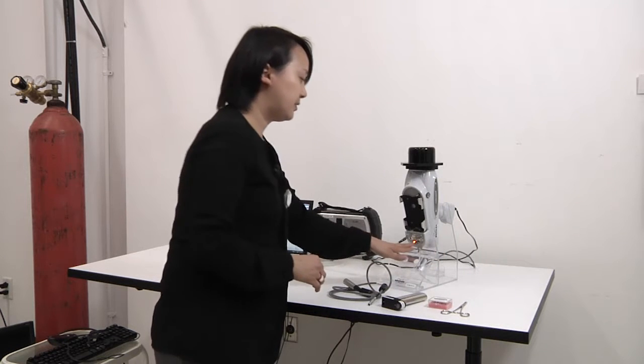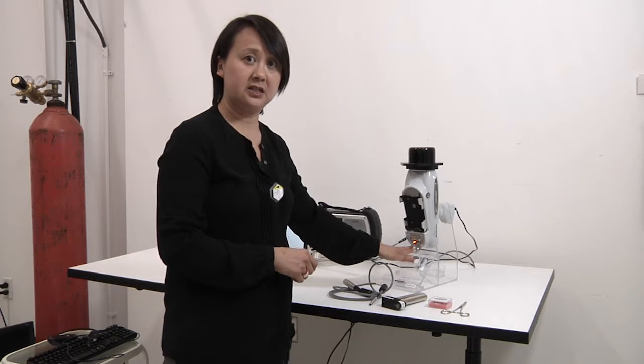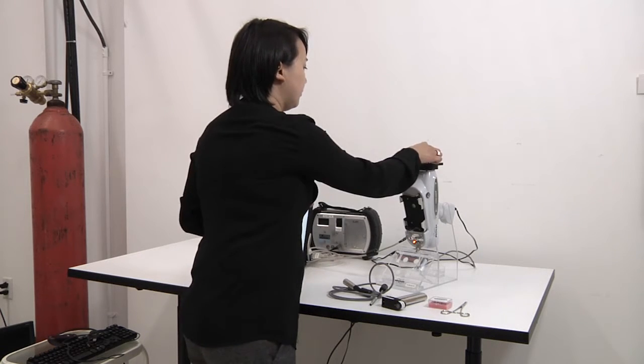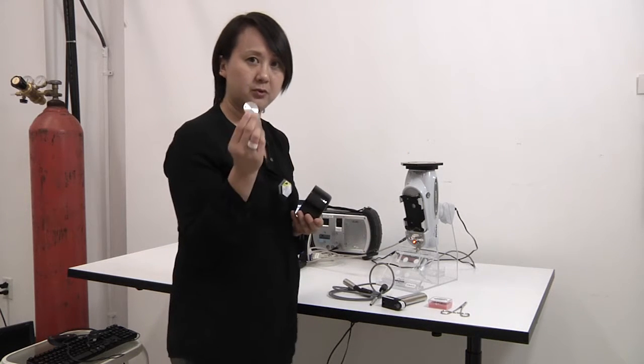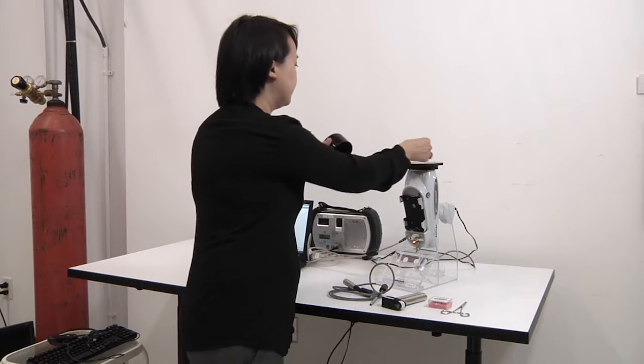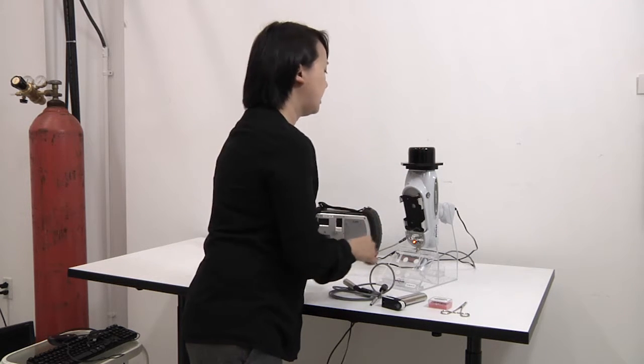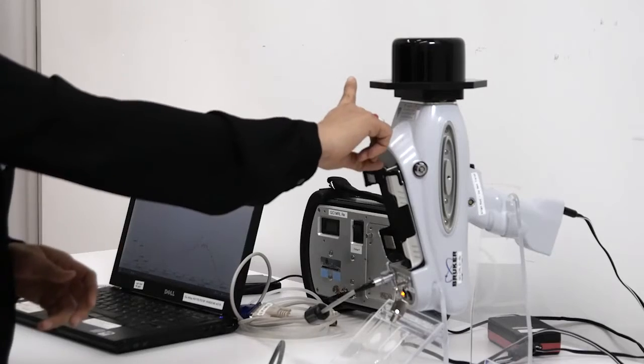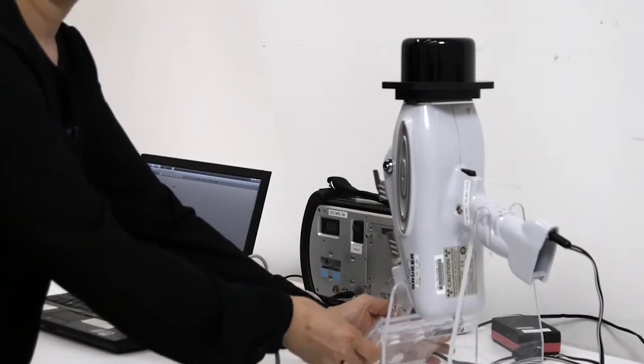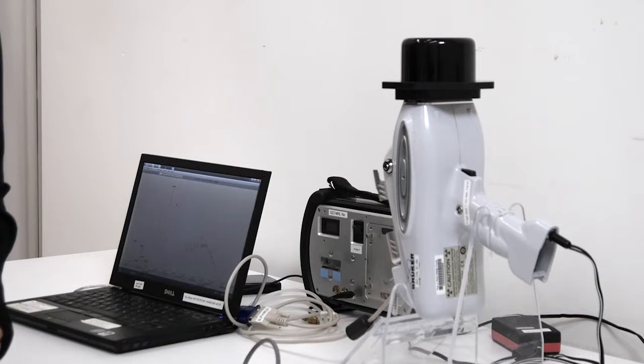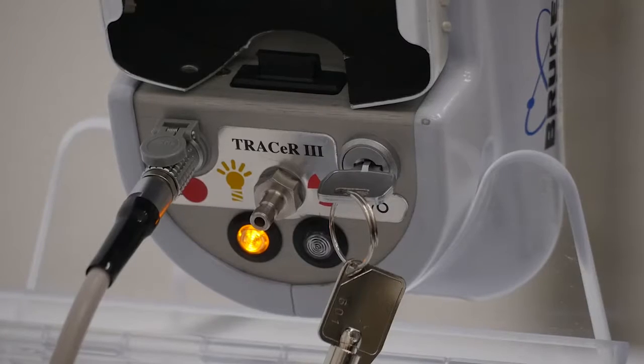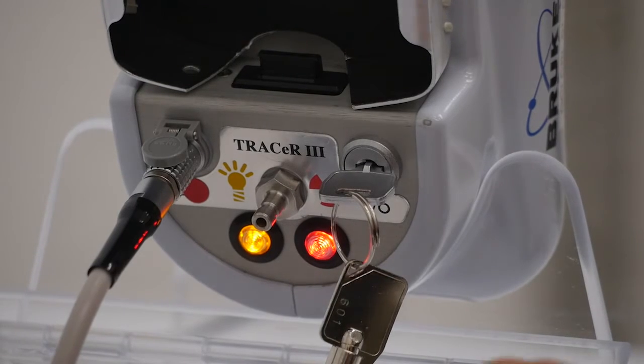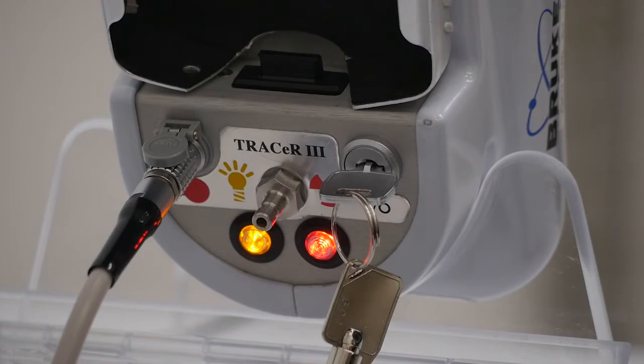So the instrument is ready, keyed in and turned on. For this session we will be using the stainless steel coupon. And as a reminder, the direction of the beam is going this way, so we will want to point the unit away from the user. When we activate the x-ray tube, this red light should turn on.